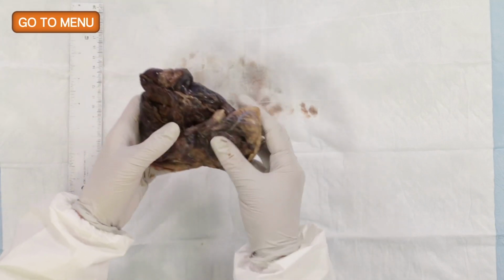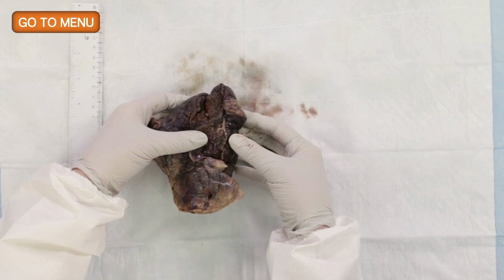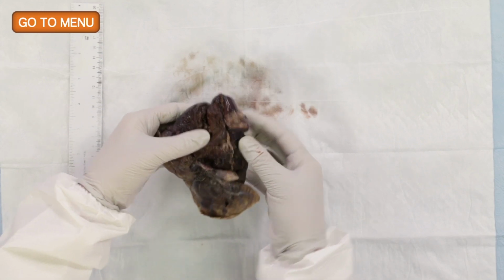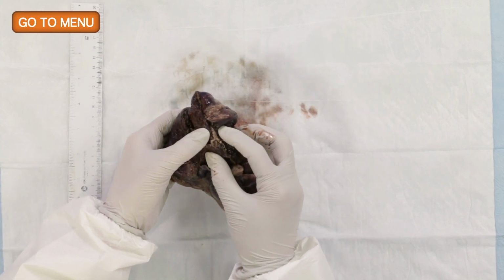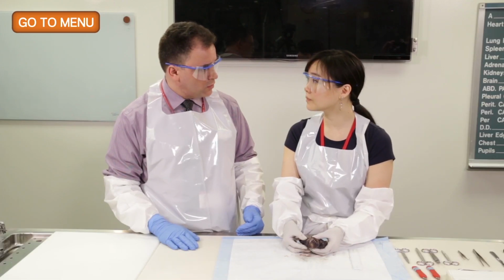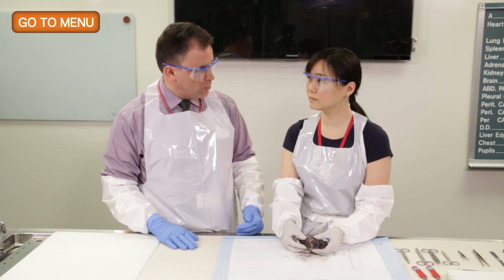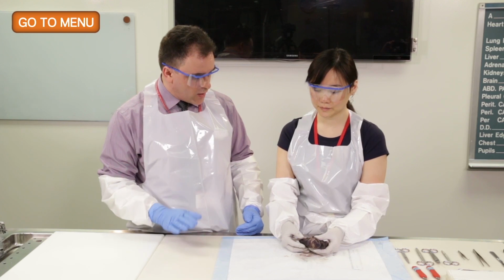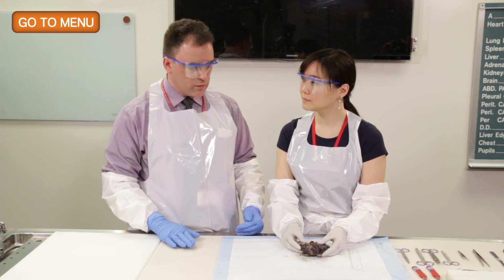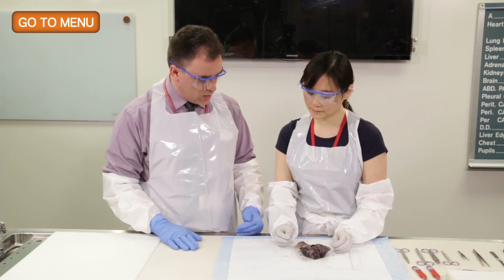Also, I would like to look at the bronchovascular margin, which is over here. And does it seem far from the tumor? I think it's actually kind of hard to tell. Clinically, on the radiology, did you find that it was an endobronchial or central lesion? No, it wasn't. It was peripheral. So is your expectation that it will be near the bronchial margin? No. So with that in mind, we can now begin to address the margin, which is a very important part of the evaluation.